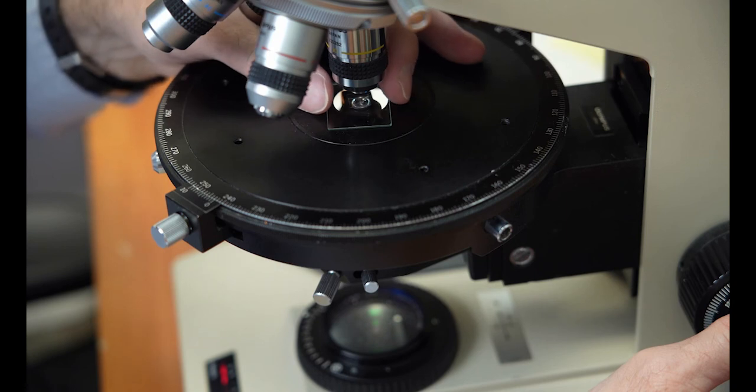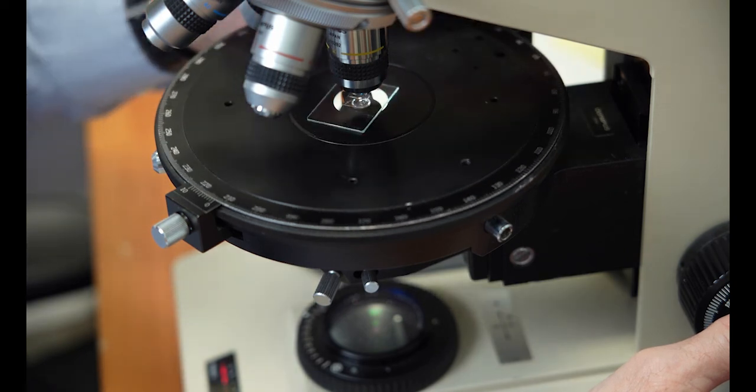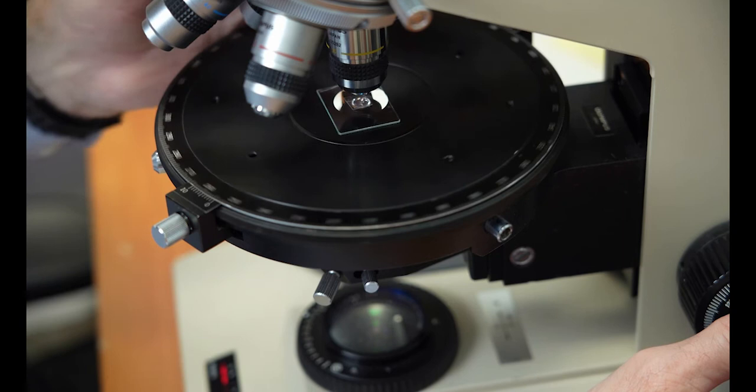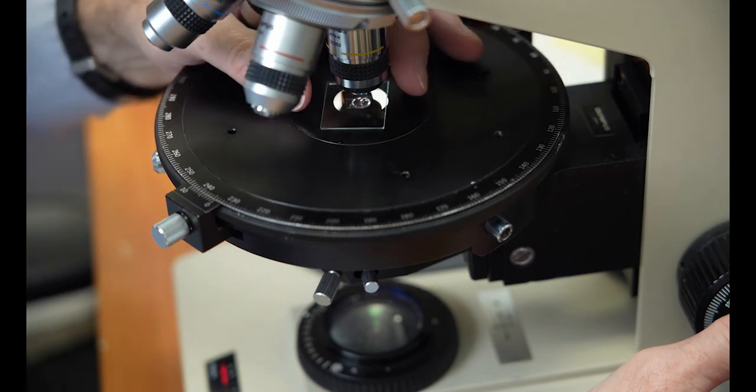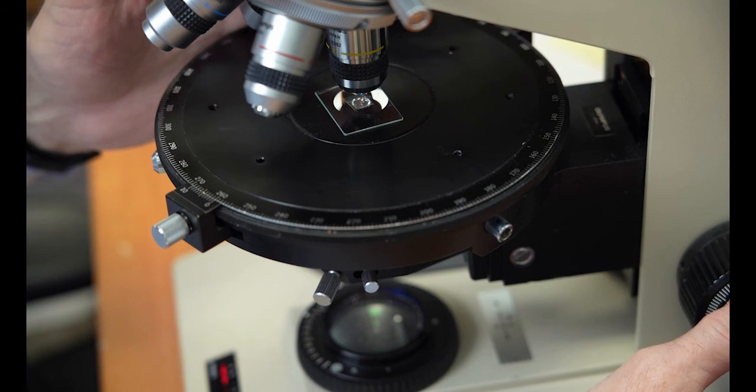And this is going across the 1 by 1 inch. You have good control of the slide. The hand still wraps around the stage and allows you to move the stage and observe your particles, while your other hand is on the focusing knob.